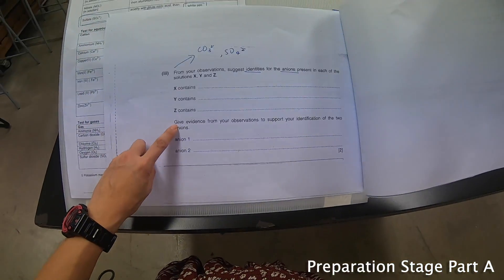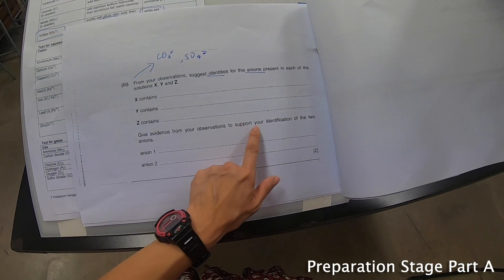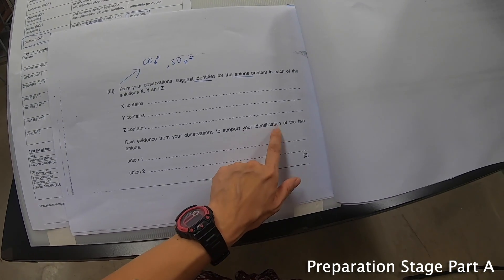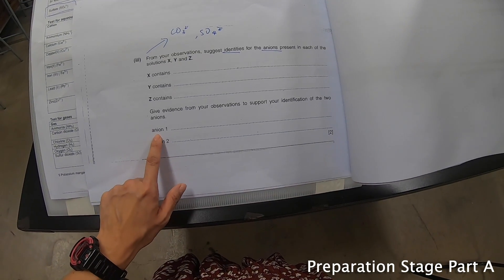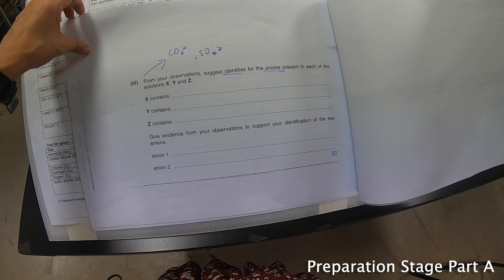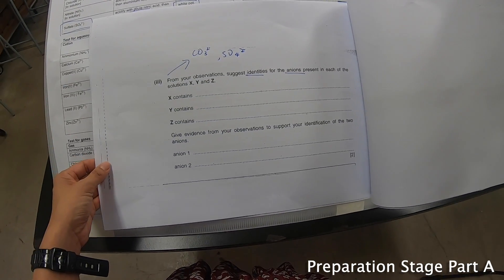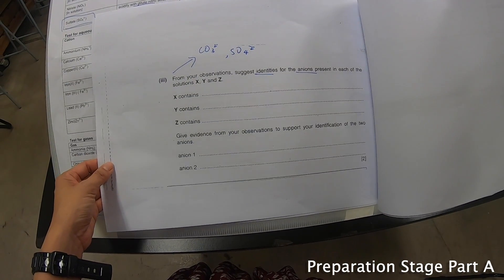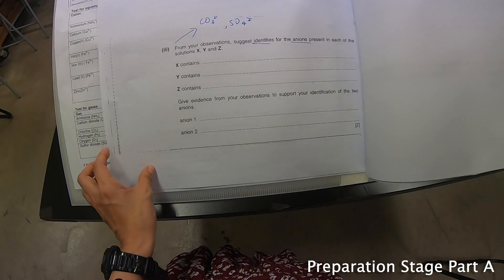The last part says: give evidence from your observations to support your identification of the two anions — anion 1 and anion 2. After doing the experiments, I will be able to see which one contains what.